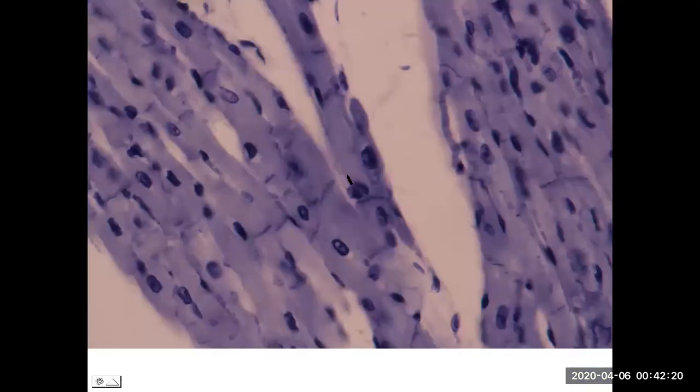And zooming in, closer view. So we can see, similar to skeletal muscle, the striations, the A and I bands. However, it's the very darkly stained, very prominent stripes, and you notice they're spaced apart, a distance from one another. Only at the border of the cell is where you find an intercalated disc. So the very dark, prominent stripes that are more spaced out.